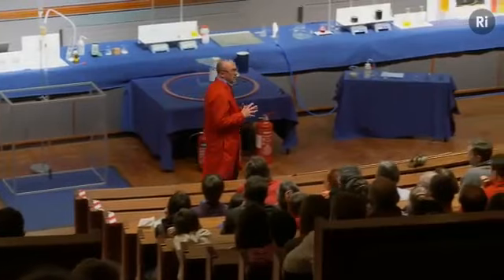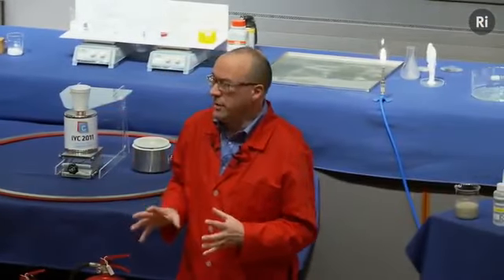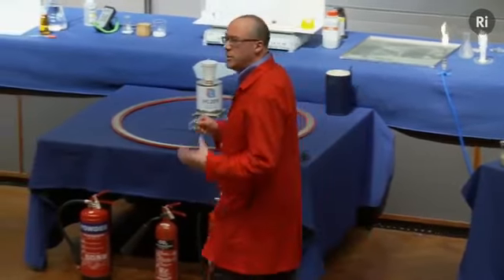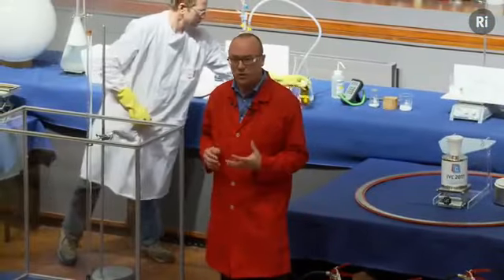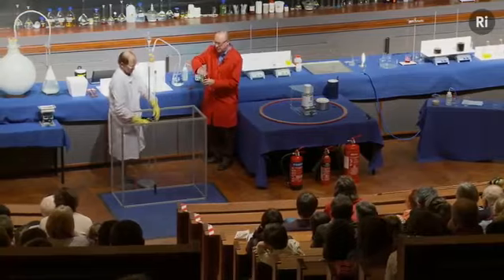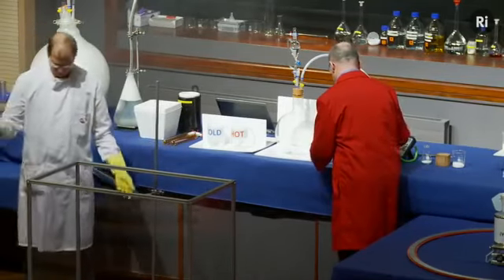Okay, so that's a chemical reaction then which gives out energy in the form of light. I'm going to show you another reaction now which gives out energy again in the form of light, but also in the form of sound. And this is a reaction between a colourless gas, which is in this glass tube, called nitric oxide, and a liquid called carbon disulfide. So this is the carbon disulfide, and we're going to add some of this to the tube, and then we're going to mix them together.